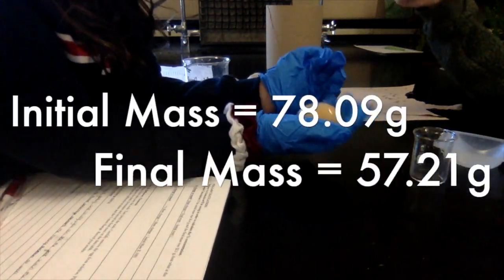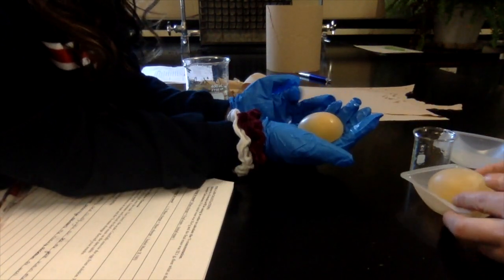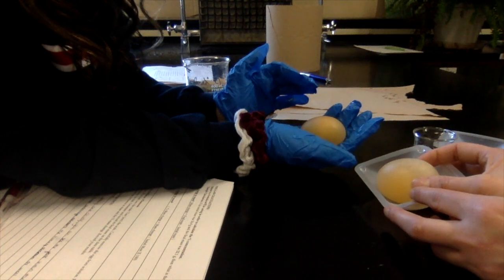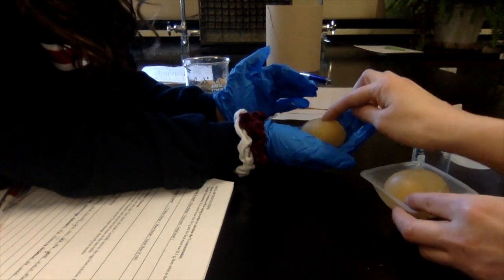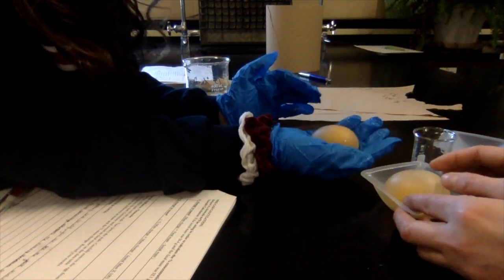What did we have? 15%? Yeah. So what do you think? Just kind of feeling it? Any differences? This one is a lot softer than that one. Okay, it's a lot softer. And you can almost see the yolk a bit more, can't you? You can. Okay.